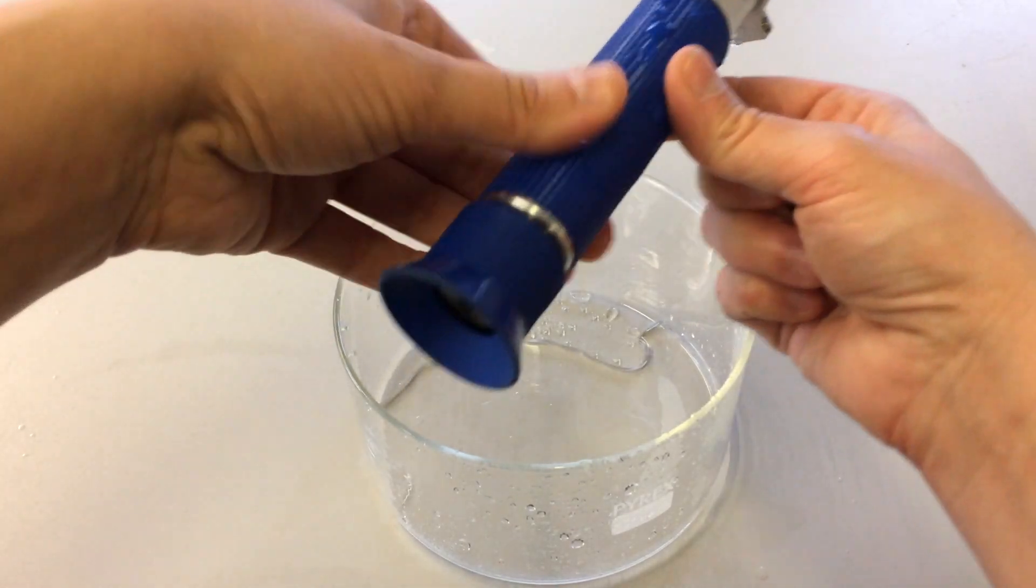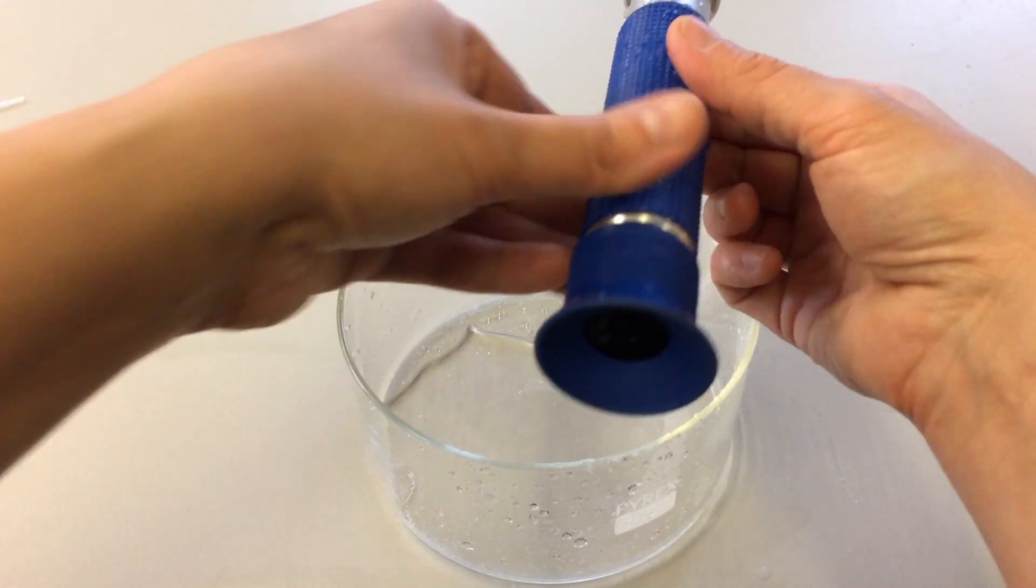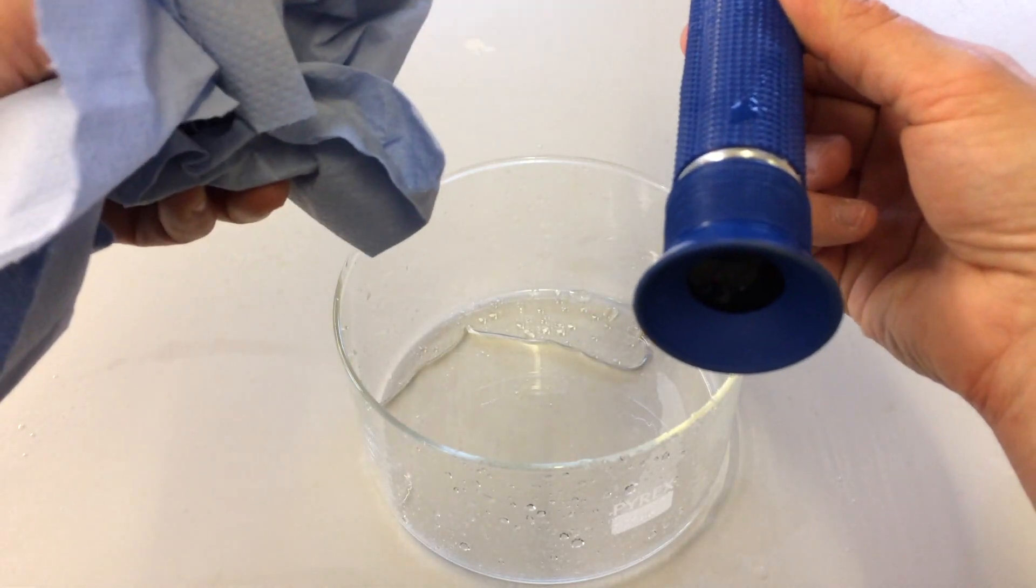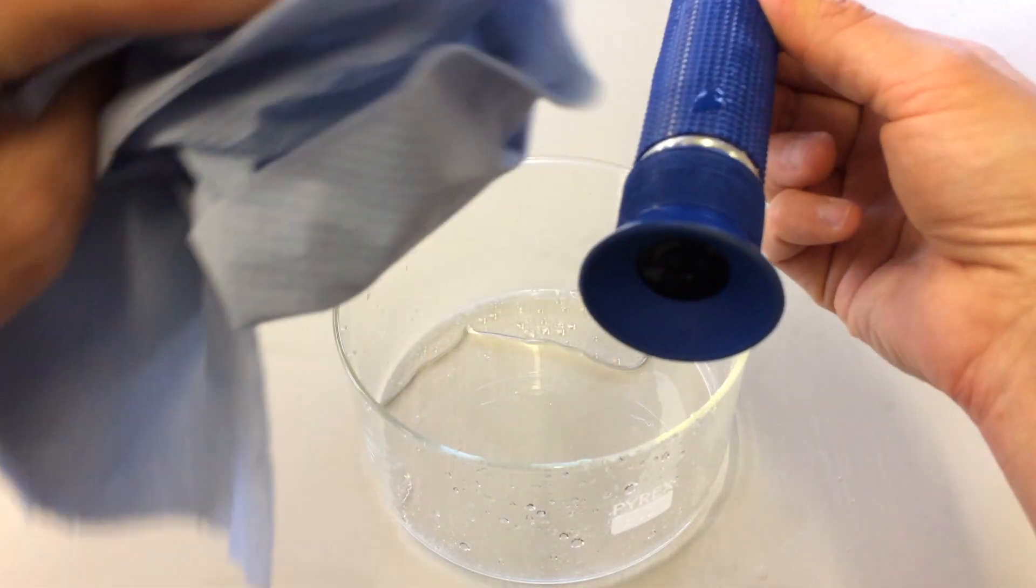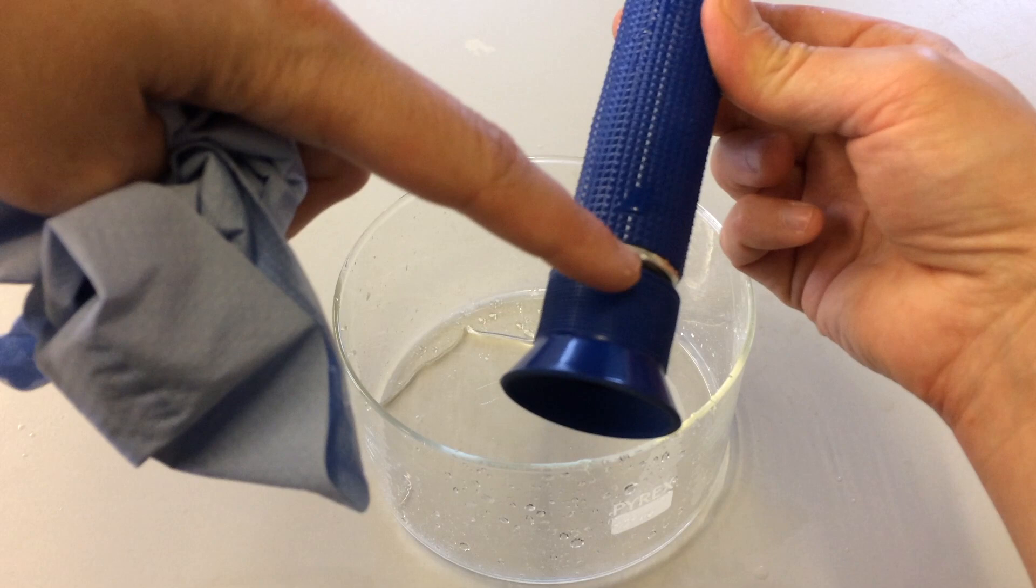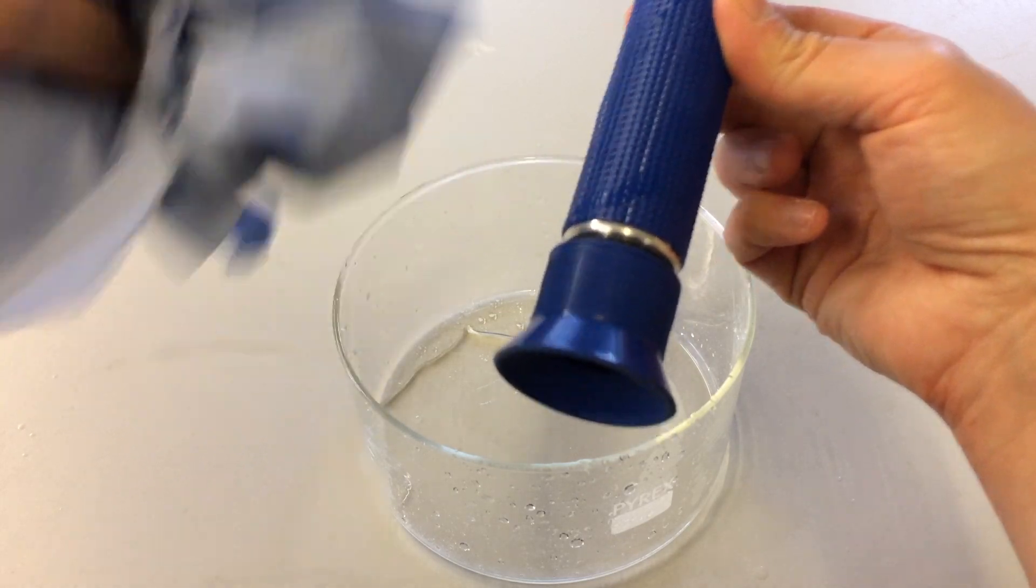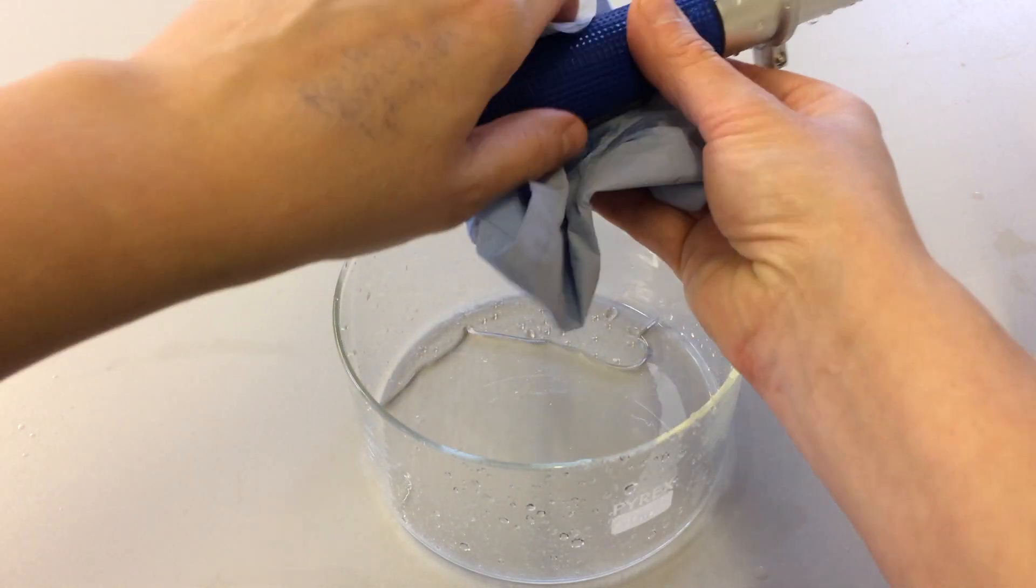Now with the eyepiece, if you do get some seawater on here, use a cloth that's covered in fresh water and give that a dab instead, because we don't want water going into this section here. Okay, so we've now cleaned that.